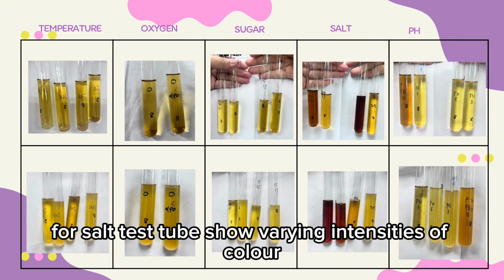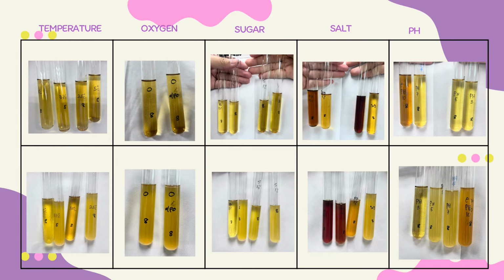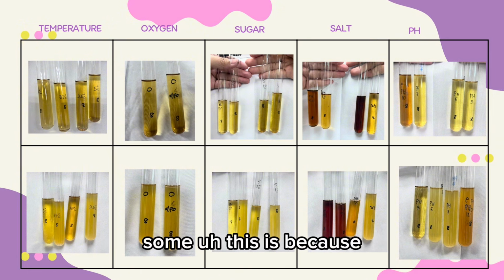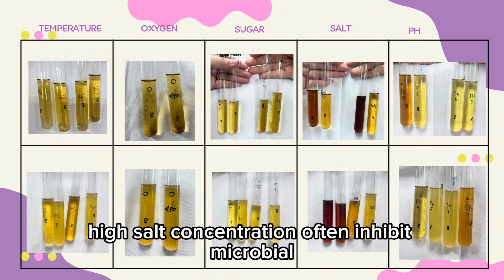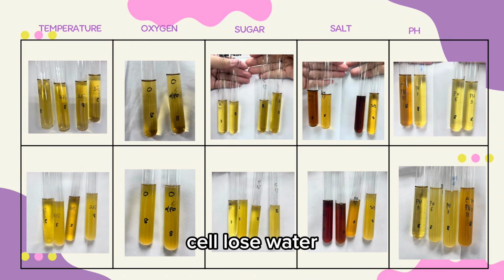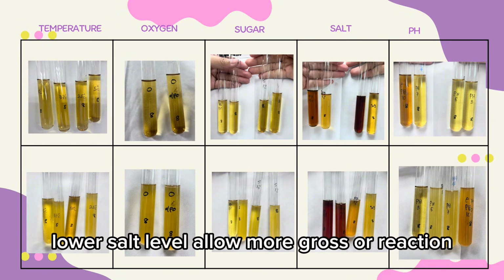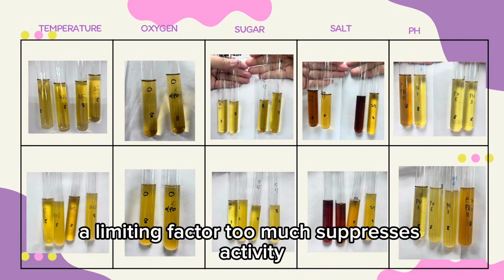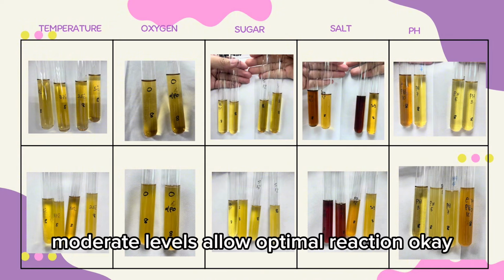For salt, test tubes show varying intensities of color depending on salt concentration. Some appear lighter, others darker. So, this is because high salt concentration often inhibits microbial or enzymatic activity due to osmotic stress, as cells lose water. Lower salt levels allow more growth or reaction, leading to stronger color change. The gradient suggests that salt acts as a limiting factor. Too much suppresses activity. Moderate levels allow optimal reaction.